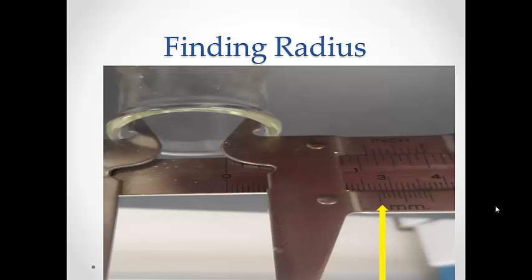So we know for sure that the inside of the cylinder measures two centimeters. It also goes just past the seven millimeter mark. Since millimeters are one-tenth of a centimeter, we can write it as 2.7.